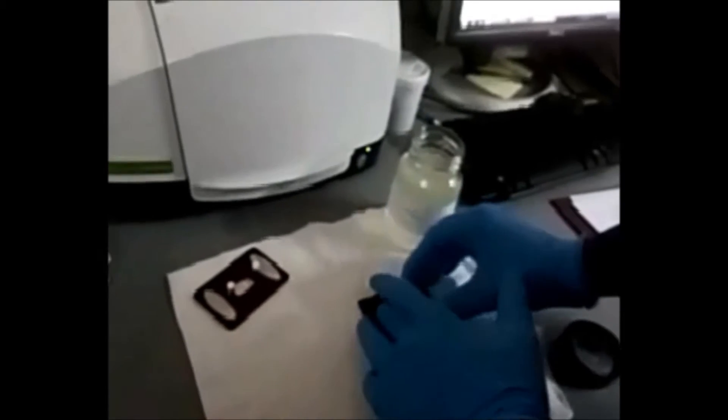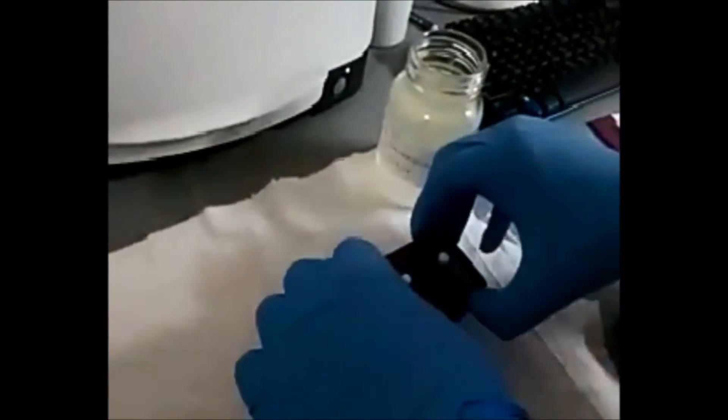What I'm going to do is just place a small speck, and this actually should be enough. It's very small. If you have a lot of sample, it will cause spreading and transference issues. So you want as little sample as possible.